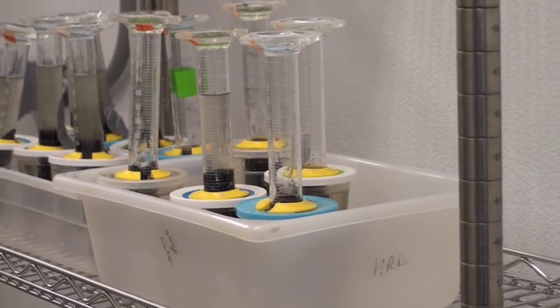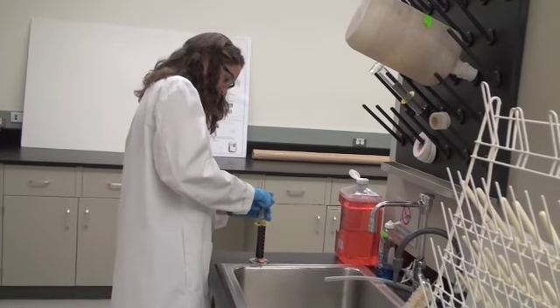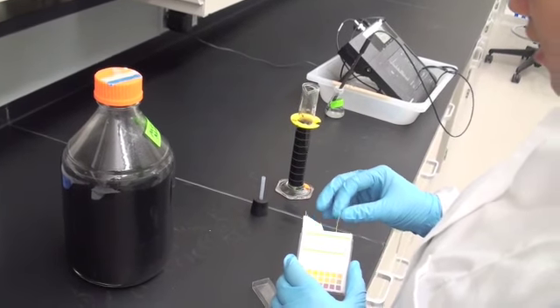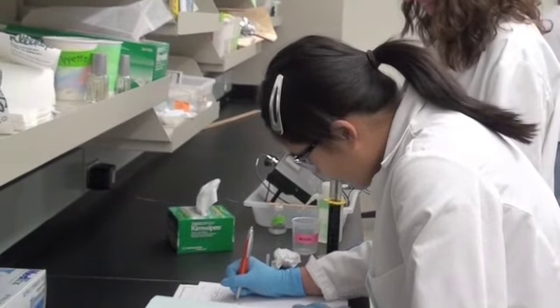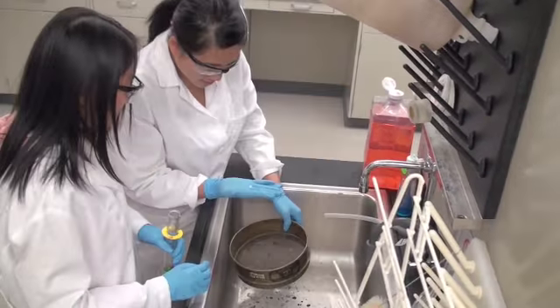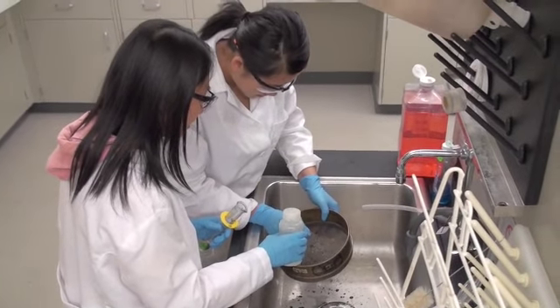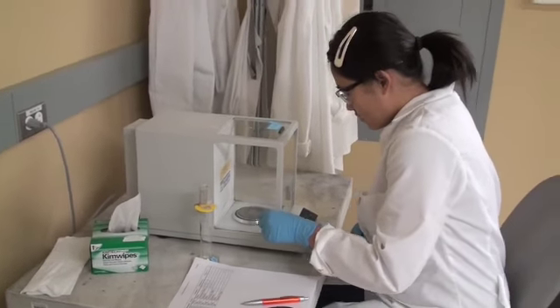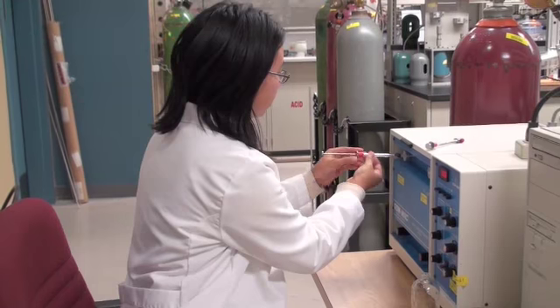Once the gas production has reached a constant value, and a gas sample obtained if you had the equipment, the microcosm may be opened. The pH of the remaining biosolids is measured. pH strips may be used, or a pH meter if available. If the investigated material is a partially biodegraded solid, remnants can be collected. This sample is rinsed, dried, and weighed to monitor the sample weight loss. An estimate of biodegradation can be determined by the sample weight loss, the biogas production, and the ultimate methane capture.